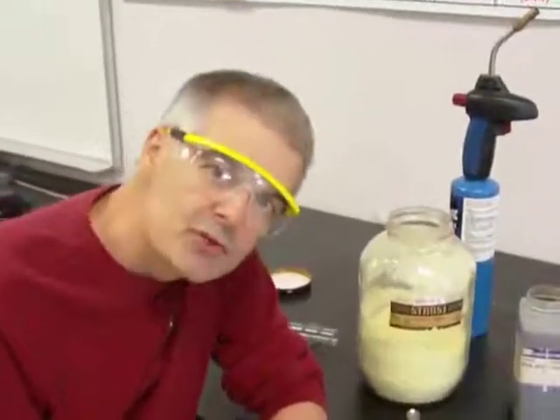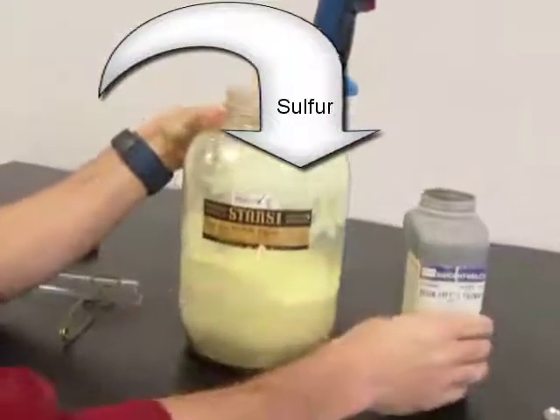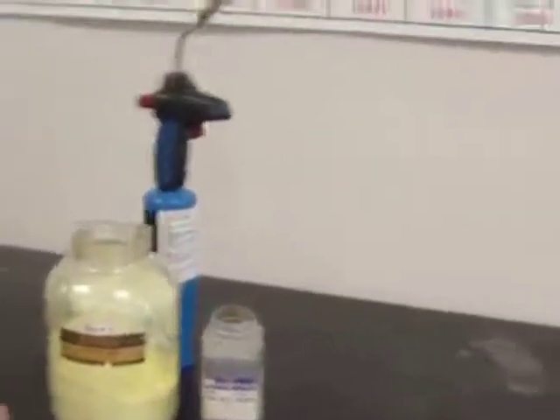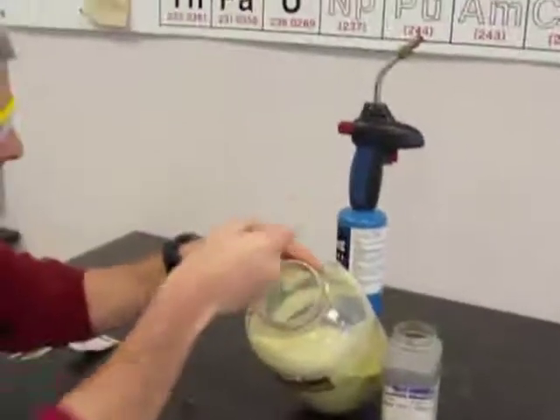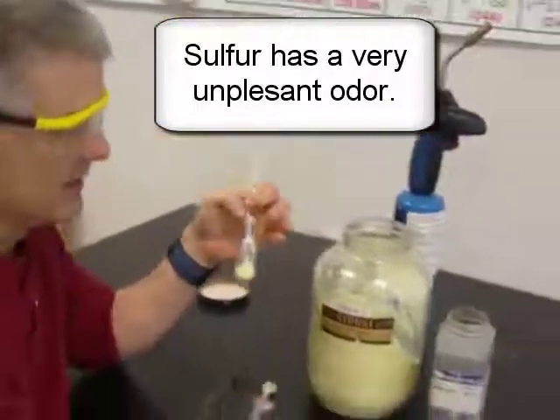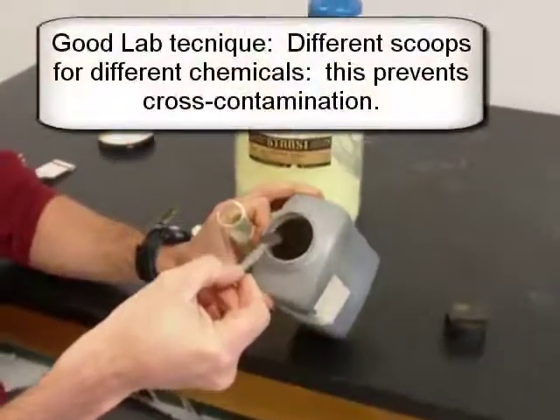I'm going to talk about a combination reaction — a reaction where you have two things that join to make one. The reaction I'm going to work with uses sulfur — elemental sulfur, S₈ — and iron metal. I'm going to put some sulfur into this test tube, and then add some iron metal. Notice I'm using different scoops for each so I don't contaminate the sulfur into the iron.